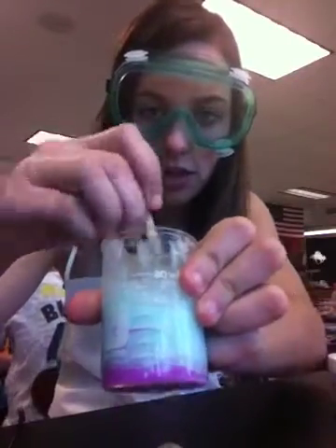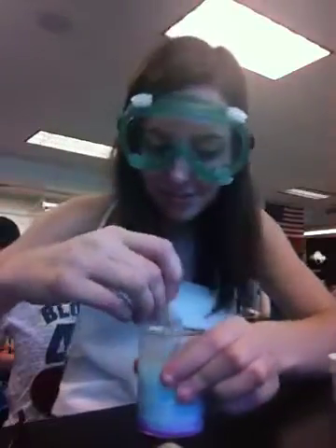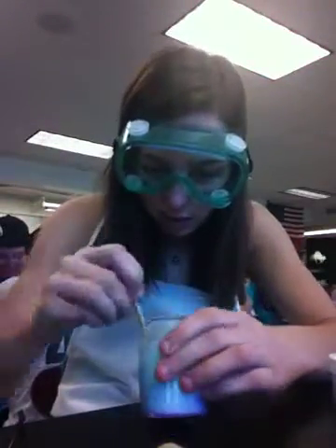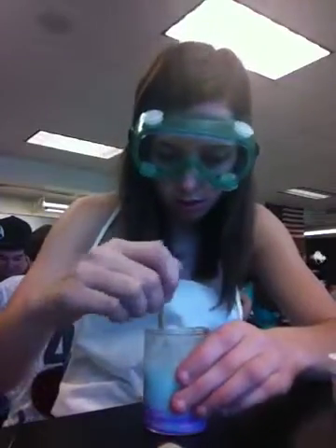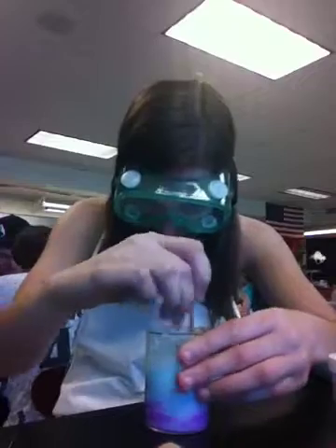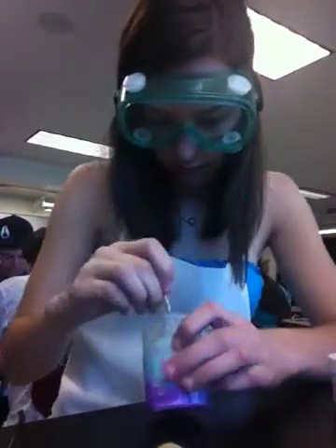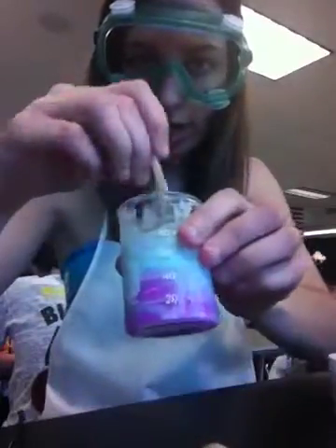See this? We're not sure what we're doing right now. It smells good though. What is this? Mondays are the worst. See all the pink?